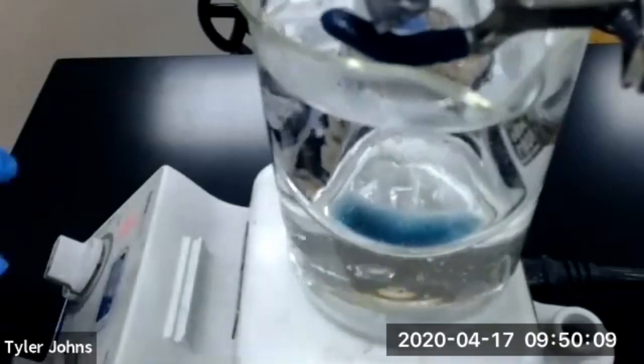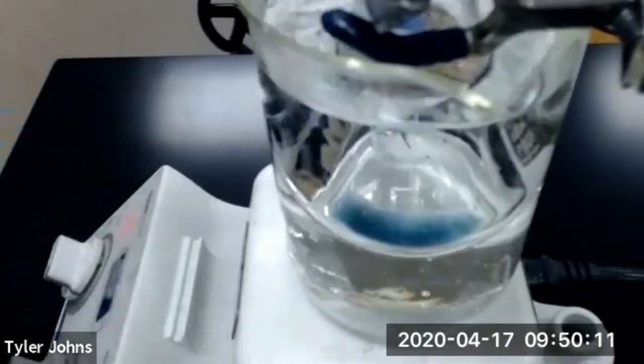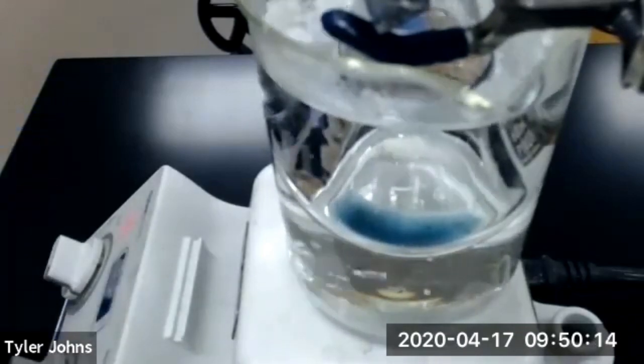You should start to see that the volume of the volatile liquid is decreasing now.